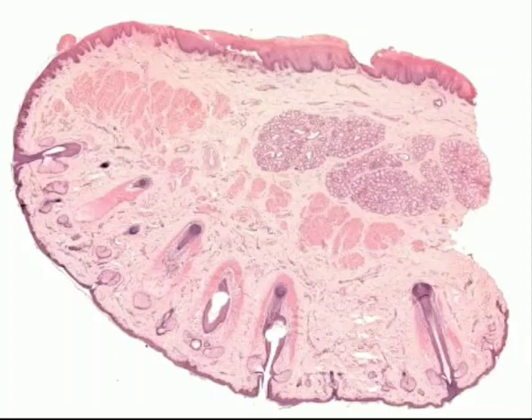It is dry in appearance, and the superficial layers of the vermilion zone are loaded with a protein called eleidin, which gives a transparent nature to the vermilion zone such that the underlying blood vessels are very clearly visible through the transition zone. Because of this, the vermilion zone appears pink, especially in fair-skinned individuals.